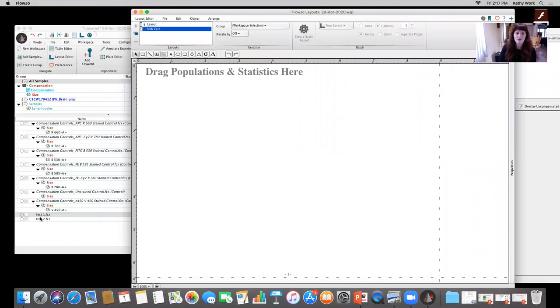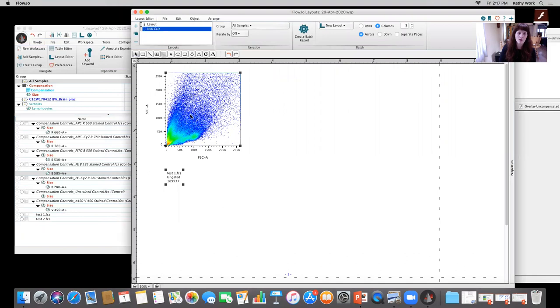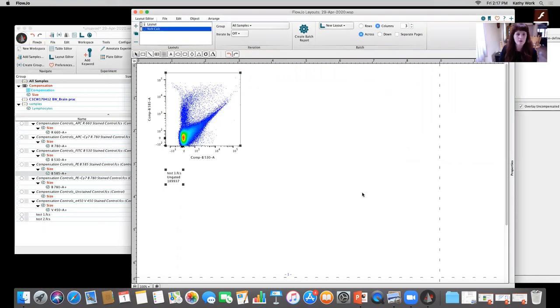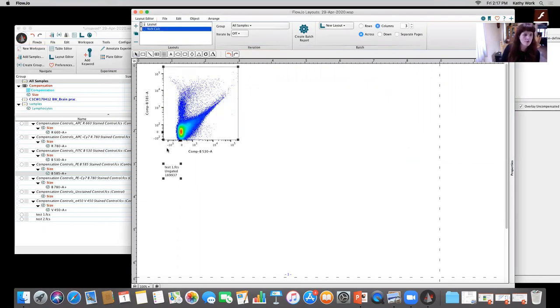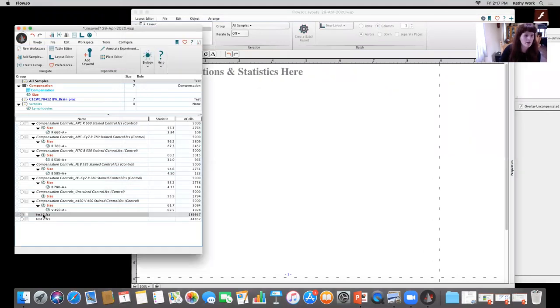So what I'm gonna do is I'm actually gonna bring in this test file. And when I bring it in, I'm going to go ahead and change it to the x-axis being the comp on the first detector, and this being the comp on the secondary detector. Threw me off for a little bit of a loop there. It'd actually be a little bit better. Let me just go back in.